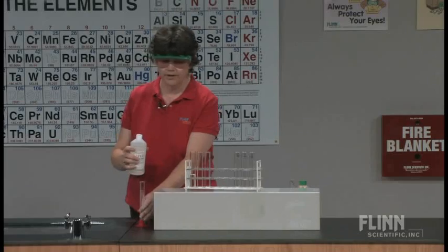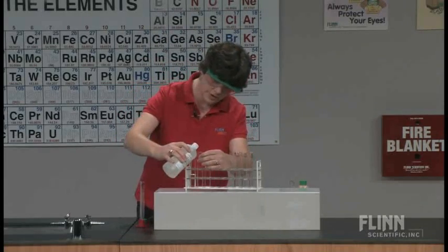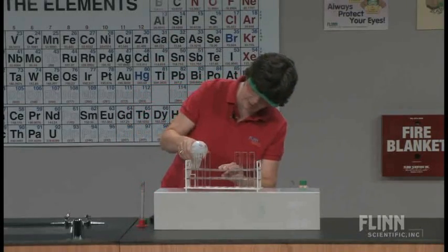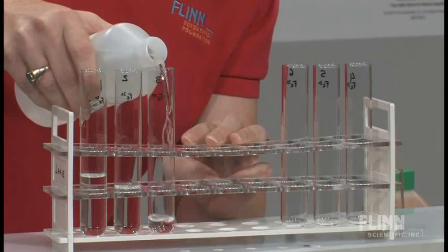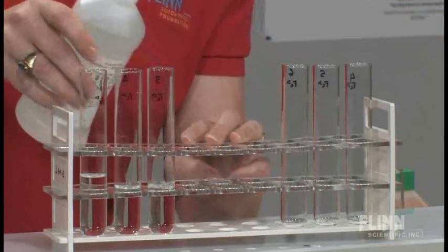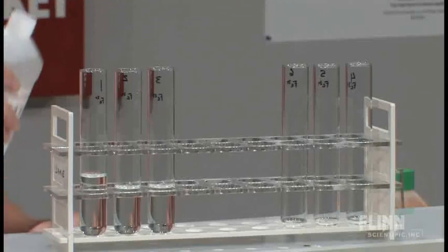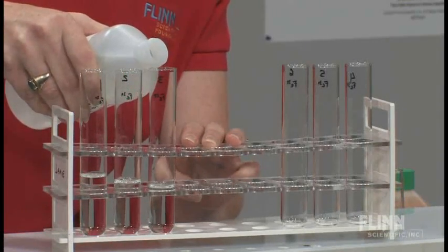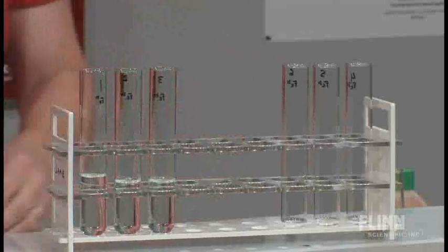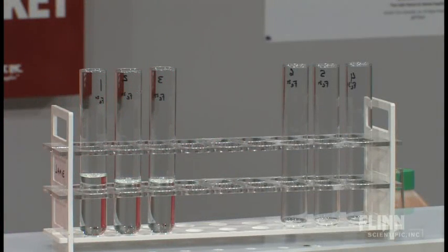Now since volume isn't that important, I'm just going to pour them so that they're about the same level. Good enough? Nope, not quite. Okay, and we can see that the iron two plus ion when it's all by itself is fairly colorless.